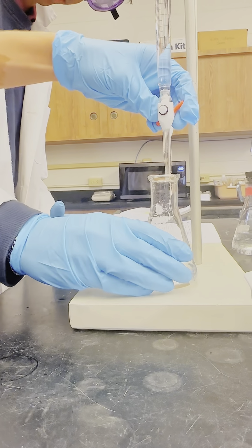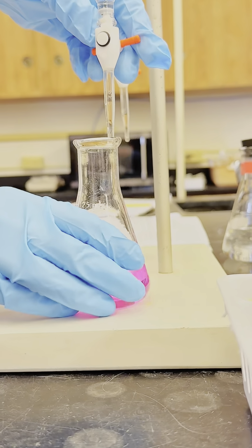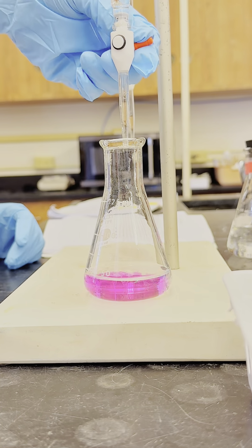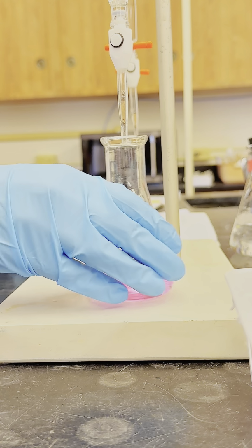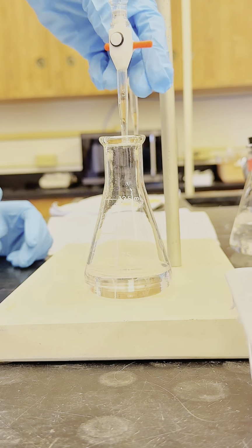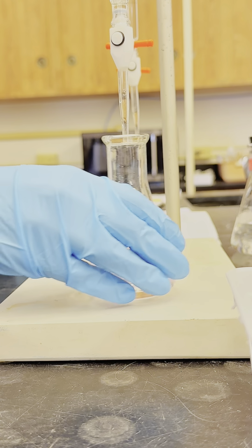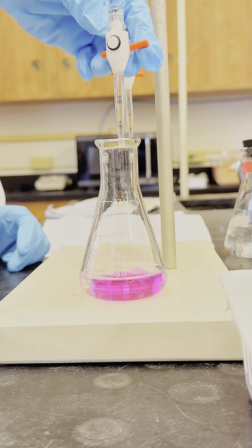The Erlenmeyer flask was placed under the base burette, tip of burette extended into the mouth of the flask. The base was slowly released from the burette into the flask while the contents were constantly stirred. The pink color of the indicator faded with the stirring. When the titration neared its endpoint, base was added drop by drop. The equivalence point was reached when a very light pink color remained after 30 seconds of swirling. After all of these steps were completed, Albuquerque had been saved, and the chemical spill had been cleaned up and solved.